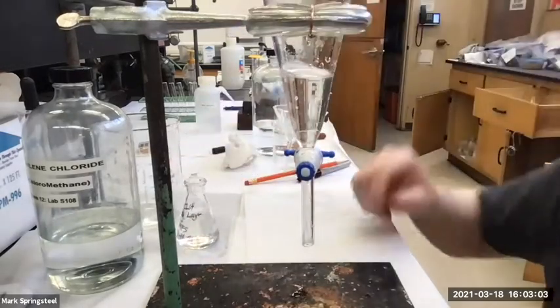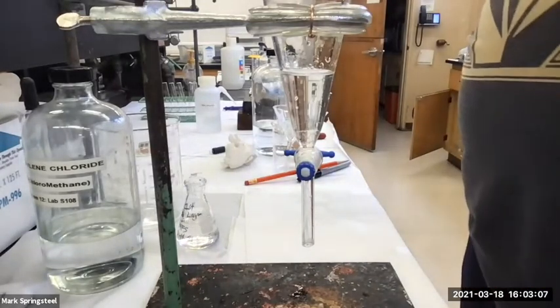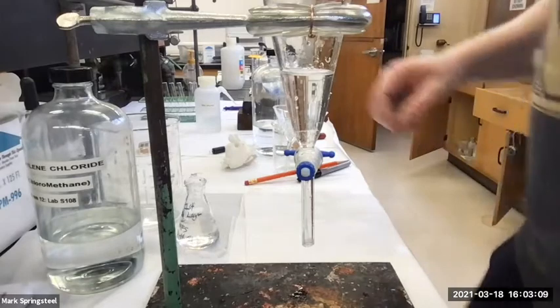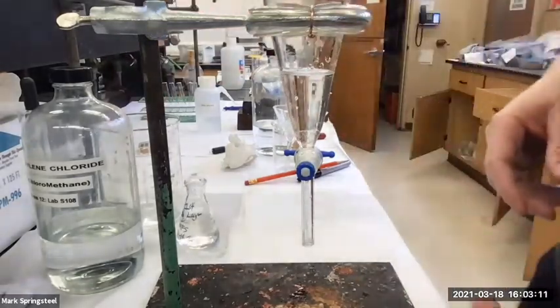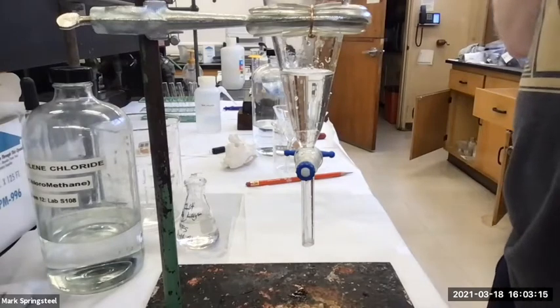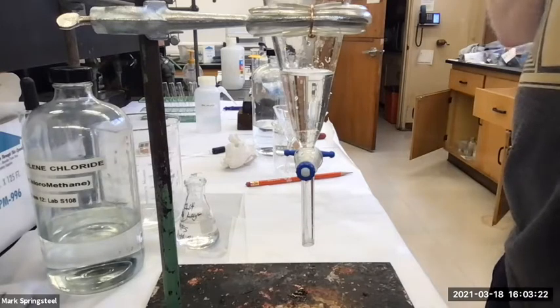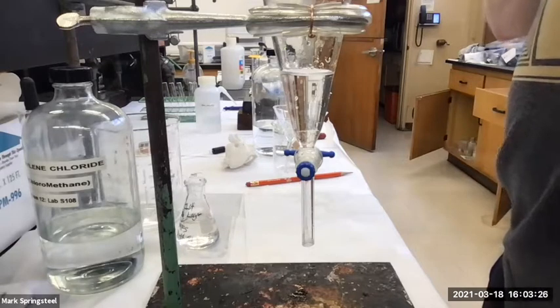So now what I want to do is check for the amine in here. Well, it's actually currently, if it's in there, it's ammonium, right? So I'll put that in a different Erlenmeyer. I'm going to label it first aqueous. It's really important that you label all these because we're going to have a bunch of these and it's easy to mix them up. First aqueous, 1 molar HCl. My initials.